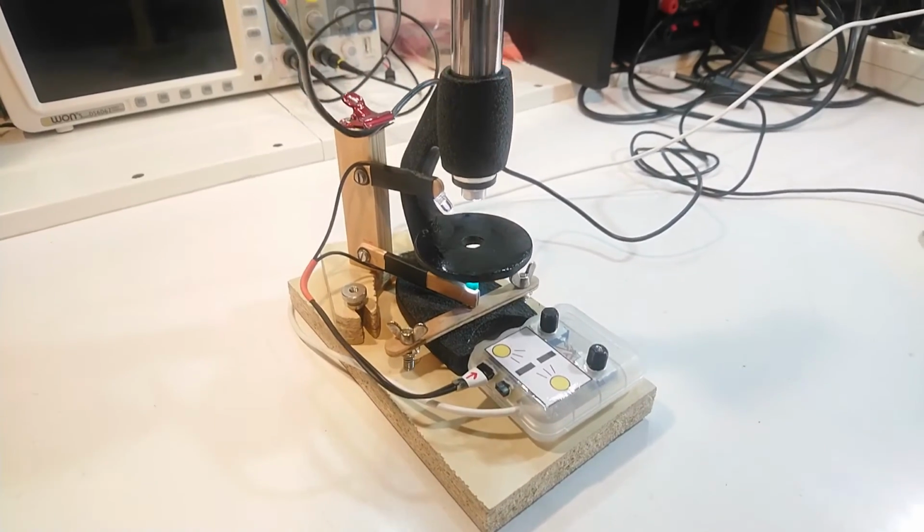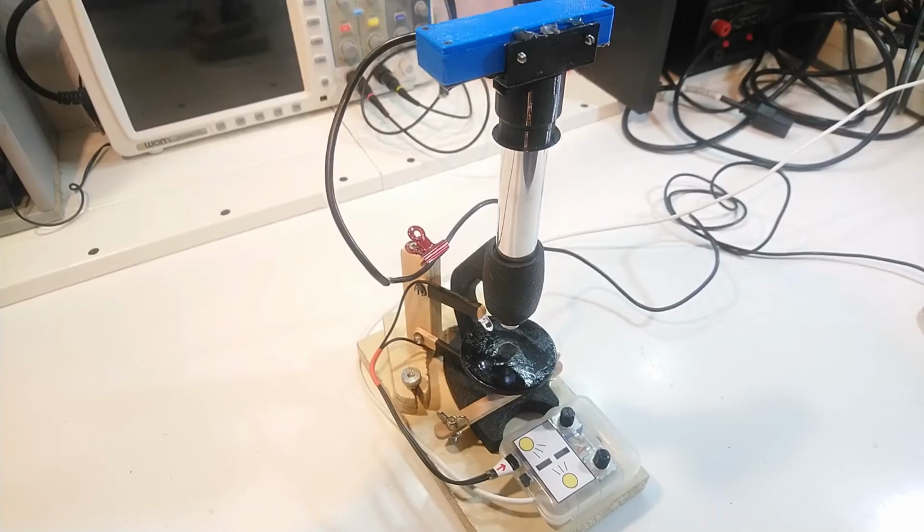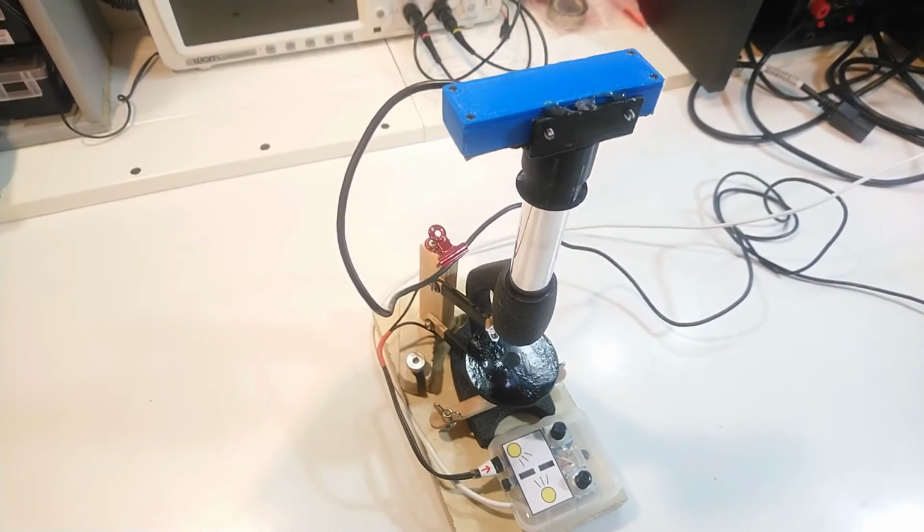Okay, done. Here's a microscope with a camera. Let's see what we can find with it. Here is nothing. I tried to clean all lenses with alcohol, but I cannot get them completely clean, unfortunately. And so I have to live with some haze and small debris visible at all times.